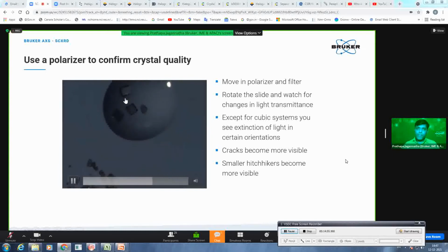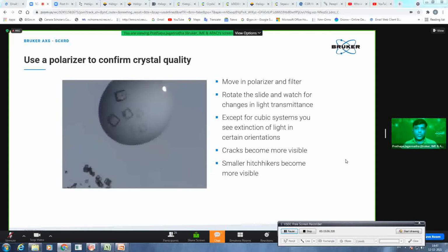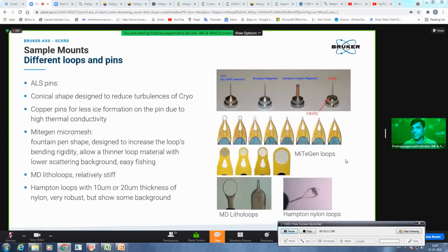This is actually the typical property of your crystal, which extinguishes the light when you rotate the polarizer under the polarizer microscope. Okay, so once he does all these things, now he is ready. So he wants to choose the mounting setup. So that is the loop.